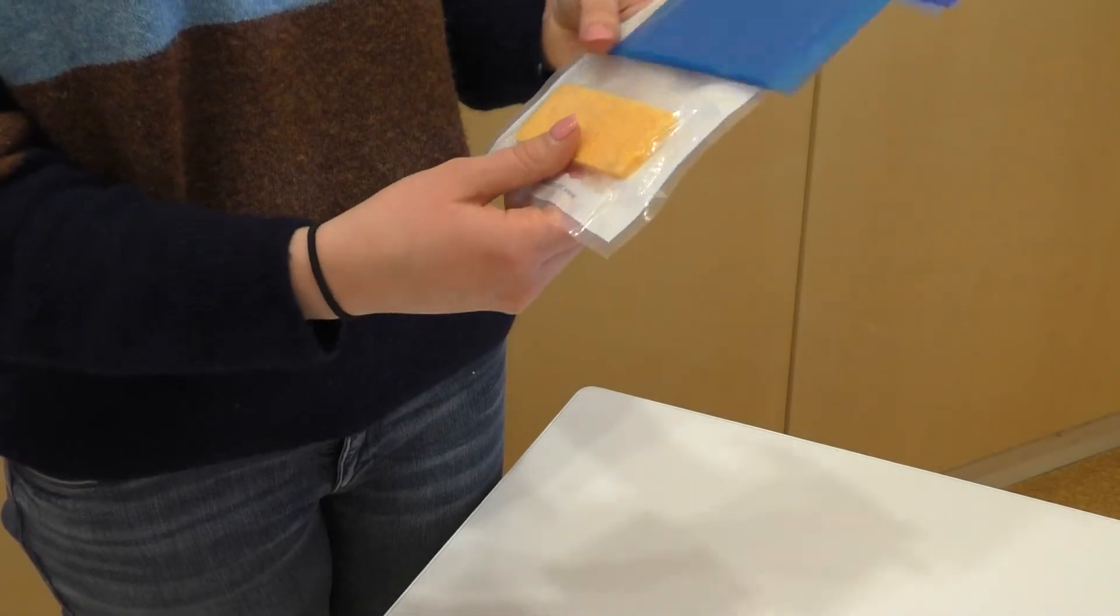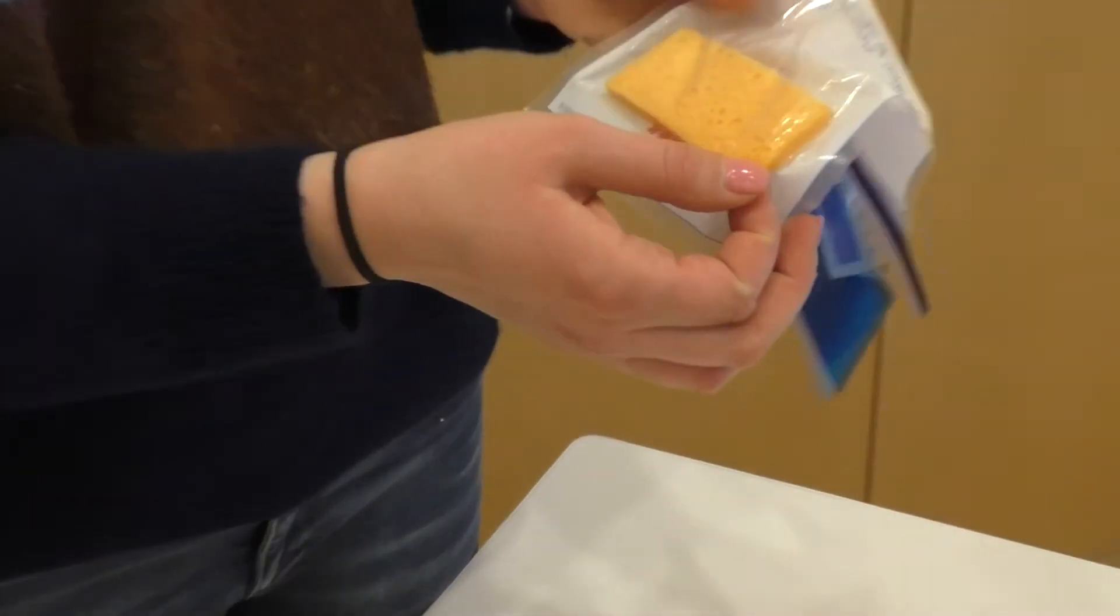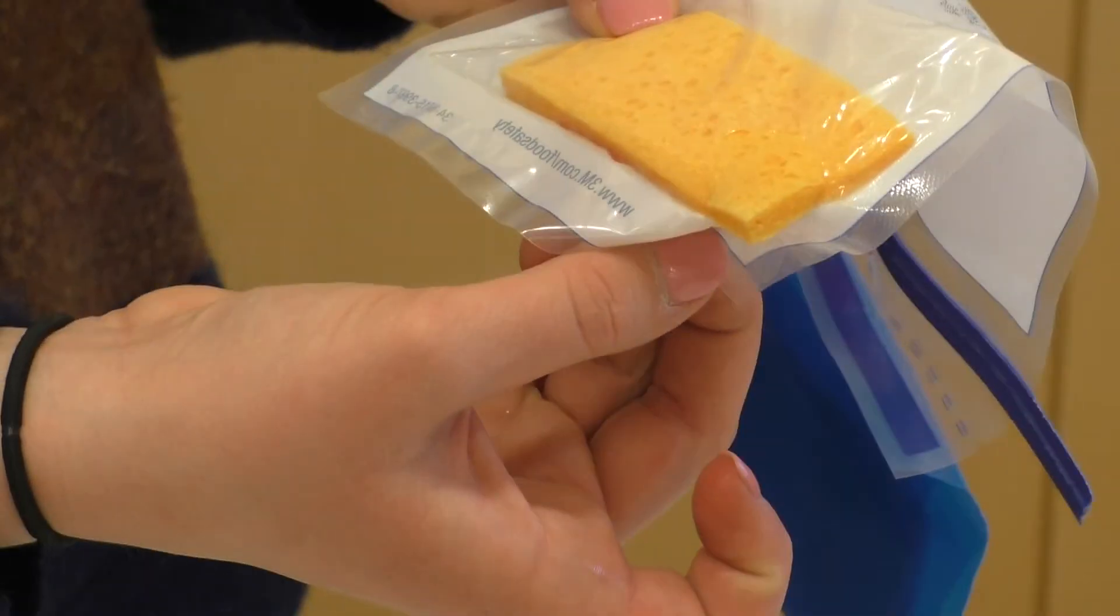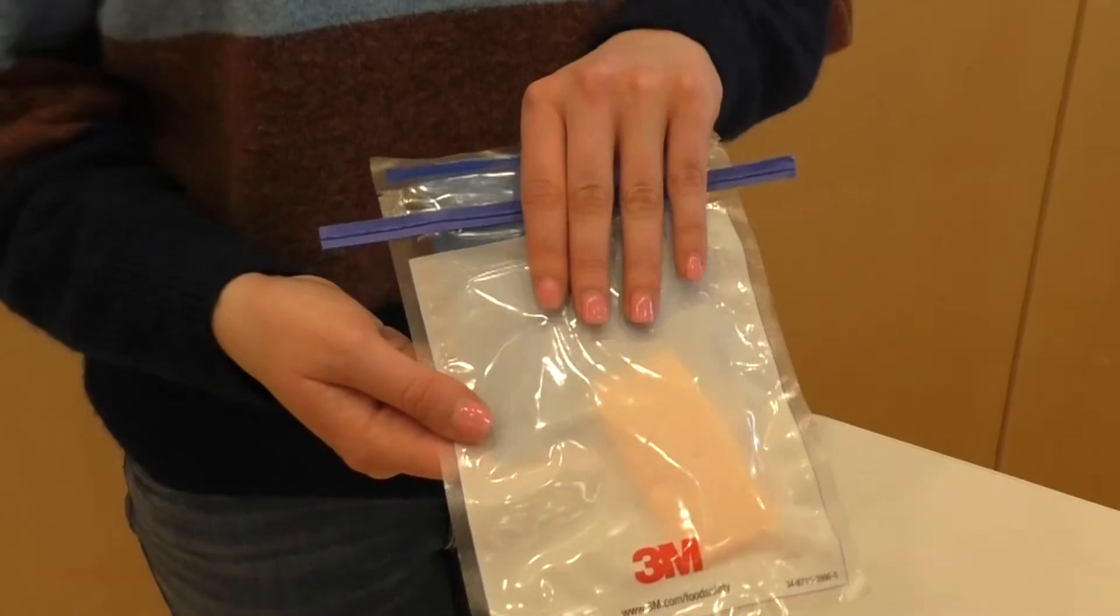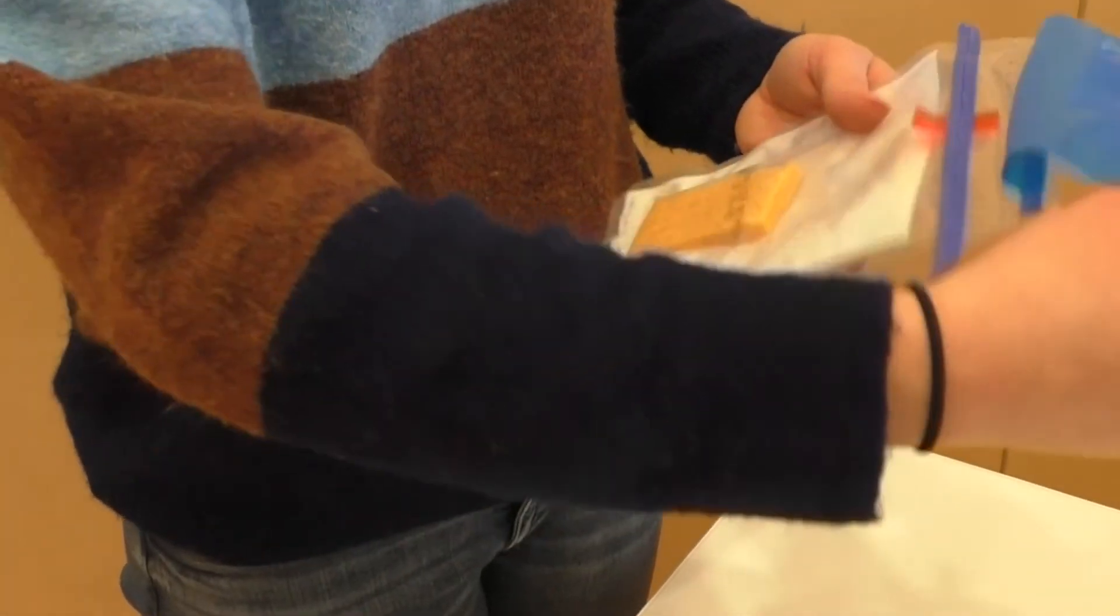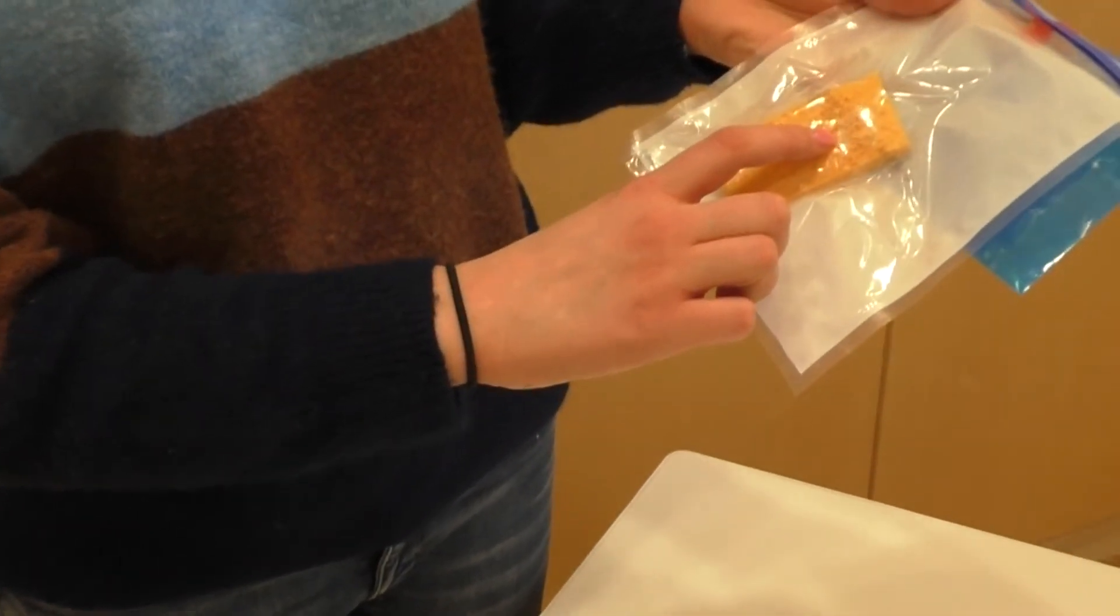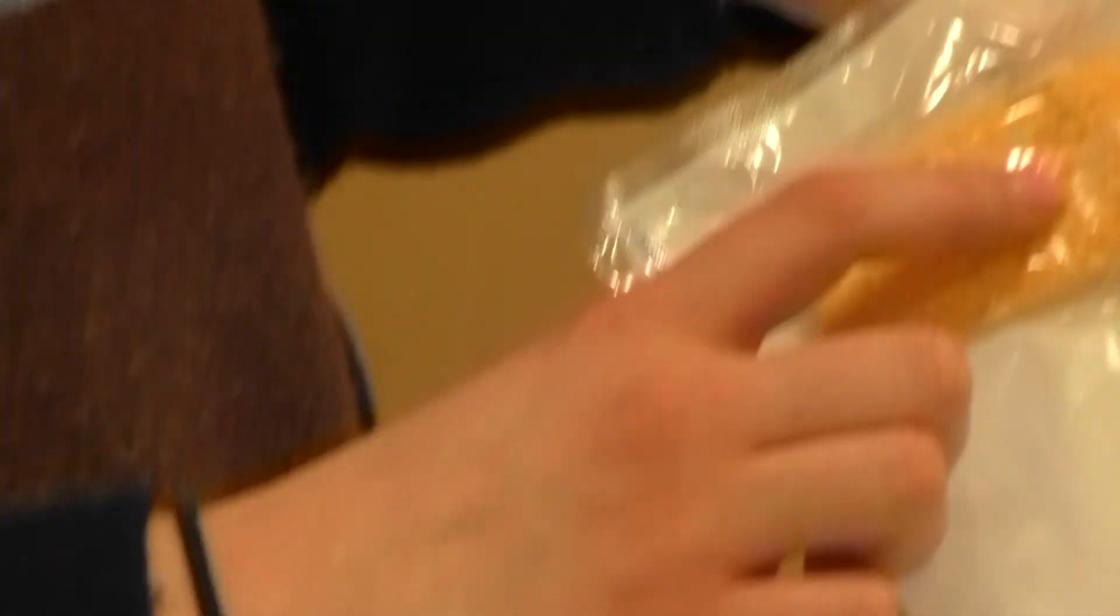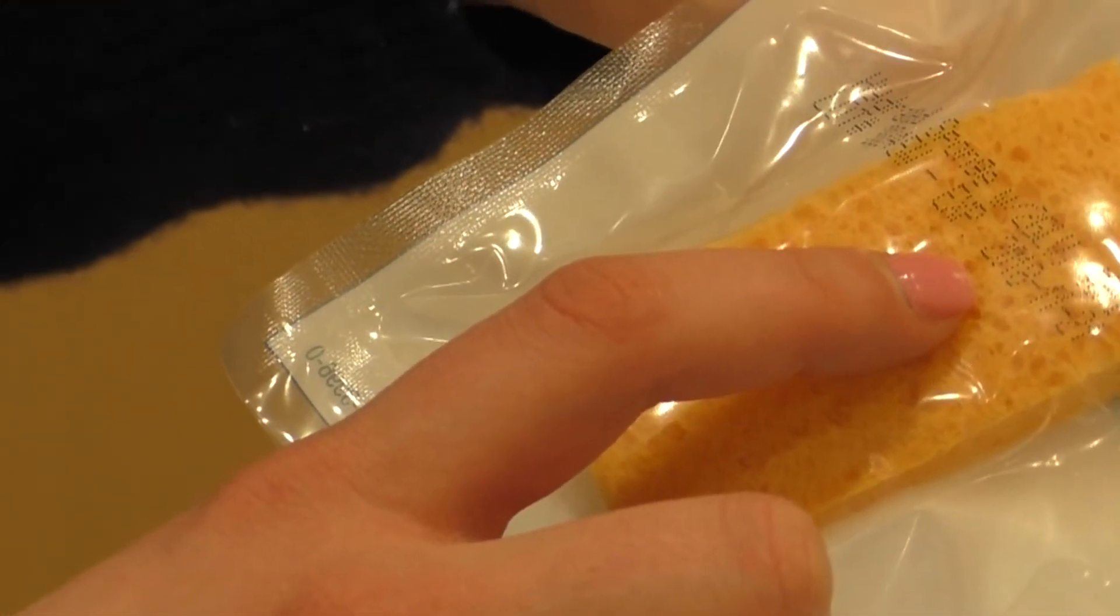Remember to check that your supplies are intact. As you are collecting your supplies, look closely for signs of damage, tearing, or leaking from the package. Check for product expiration dates, and if a package is crushed or torn in any way or the expiration date has passed, discard and replace the item. You must start with sterile supplies.